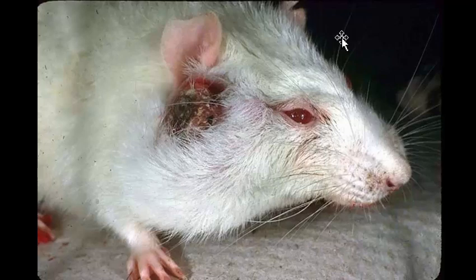This particular gland is a gland that's a combination of sebaceous gland and squamous epithelium. Either of those, when they get ulcerated, tend to get really ugly looking. And so I just call them all Zymbal's gland tumors. Rarely you'll get papillomas of the Zymbal's gland, maybe that's about 2% of all the tumors. So Zymbal's gland tumor, and drive on.